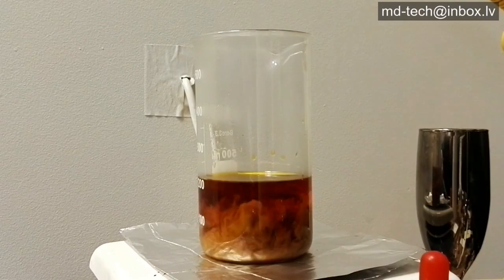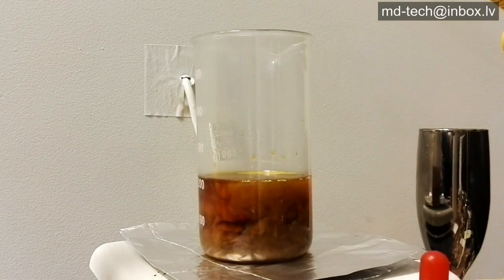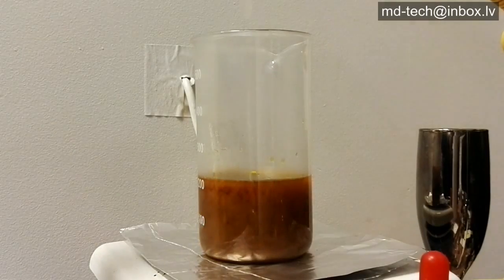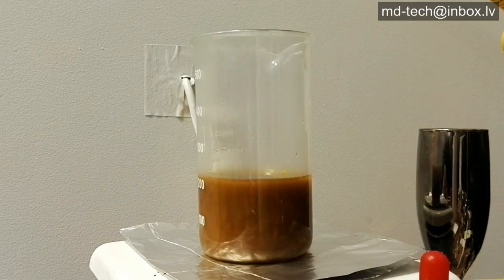Because it is aqua regia, there remains a little nitric acid and nitrates. In hot solution, gold precipitates out and dissolves again. This reaction drives out any nitric acid. The hot solution decomposes through formation and re-dissolution of gold sulfite.